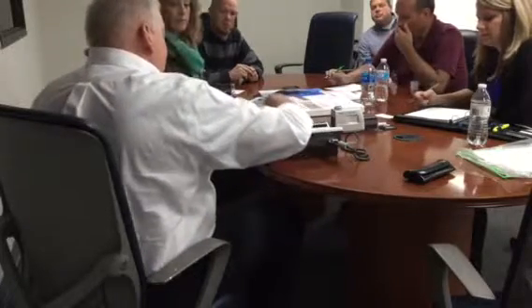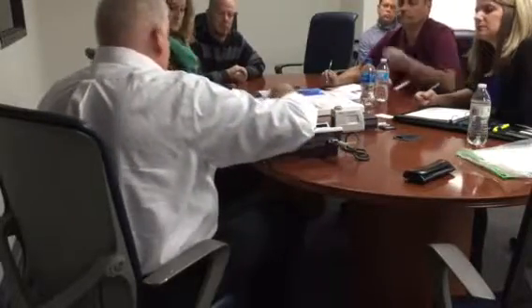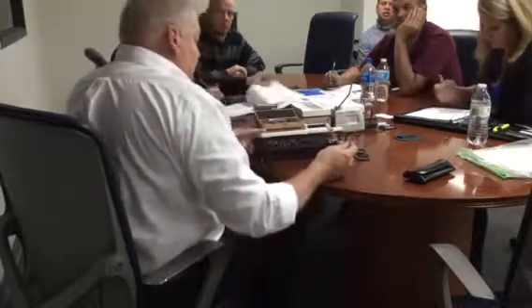In lambda C, you've got the speed button. This is your measuring condition. So here, this is called evaluation condition. So how am I going to filter the data? And then measure condition is what do I want it to do. So measuring speed is 0.5 millimeter per second. The only thing I care about on this page is on page 2, there's an auto return.